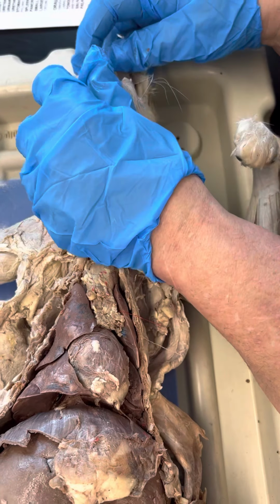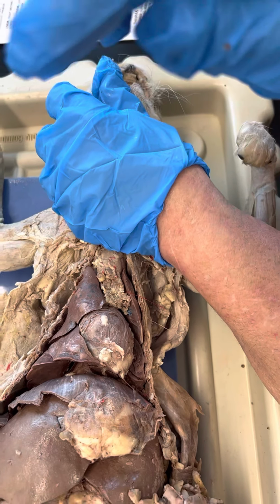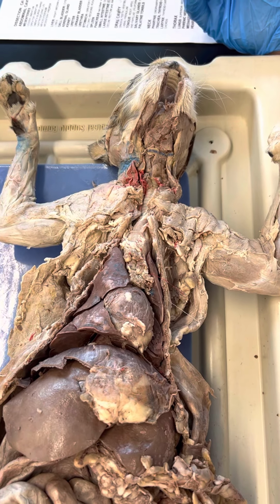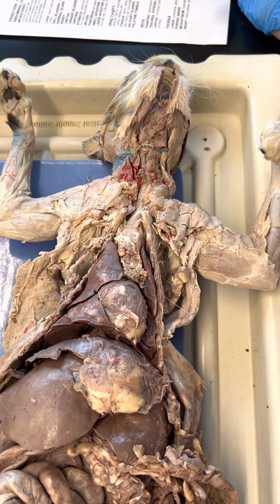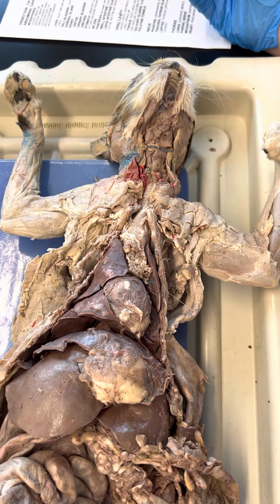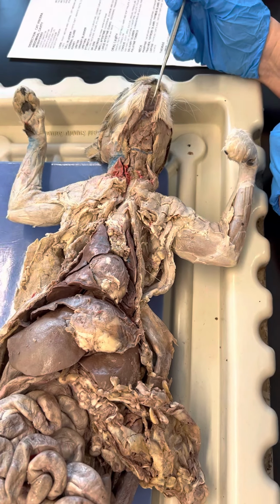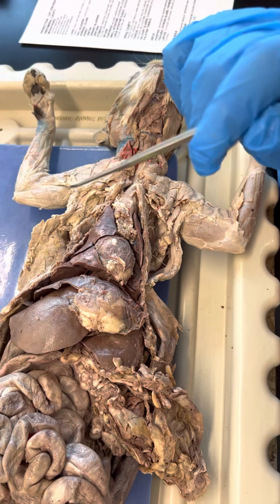I don't think I can see the lingual tonsils on this cat. That sounds like a model problem. I would go with the model on lingual tonsils. I don't think they're going to be able to find them on the cat. I've never been able to find them on the cat. They do have them, but they're really hard to see, and they're really small. If that's the only thing you miss, I wouldn't worry about it. They would be under the tongue, like little masses of lymphatic tissue. It's hard to get it exposed and pinned, and that doesn't mean they wouldn't try, because you have to be able to see the actual type of tissue. I would look for tonsils on the other models, definitely, but not on the cat. I wouldn't worry so much.